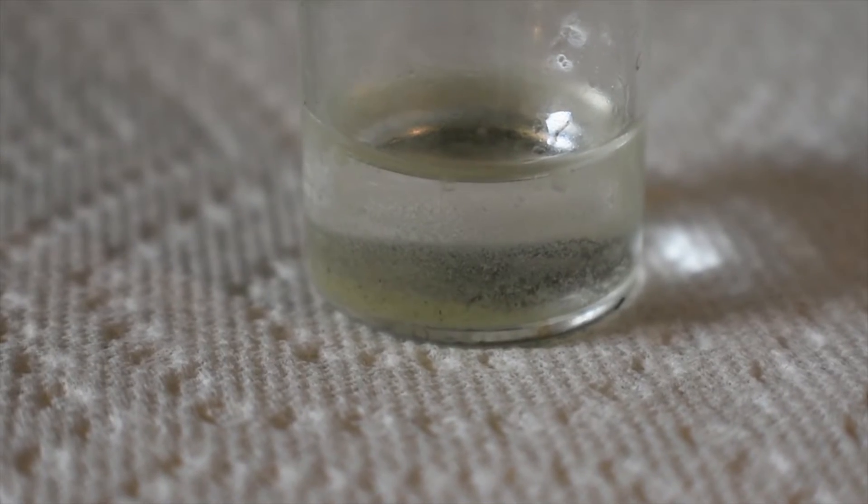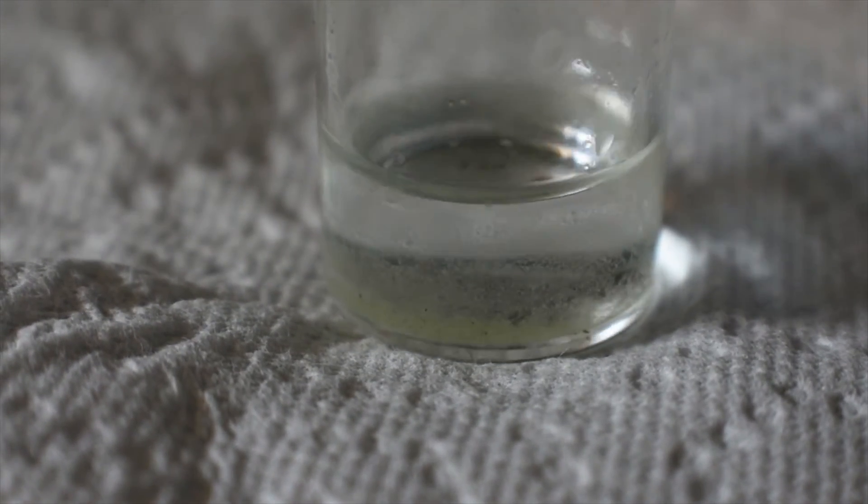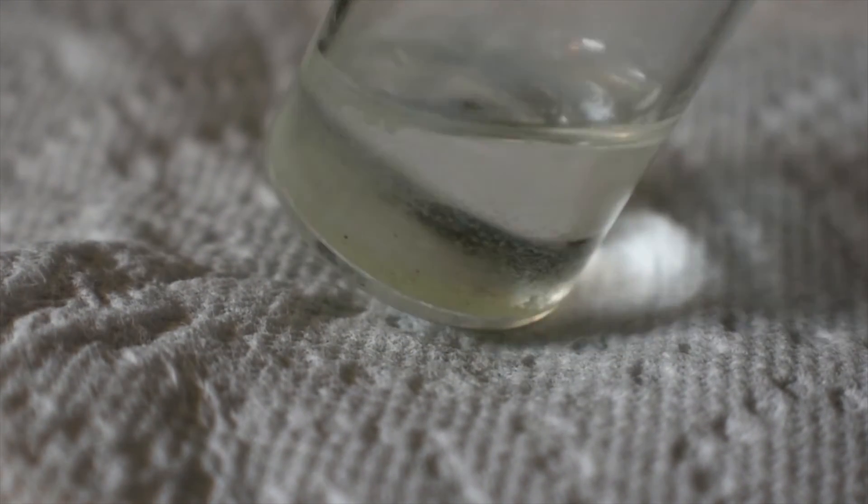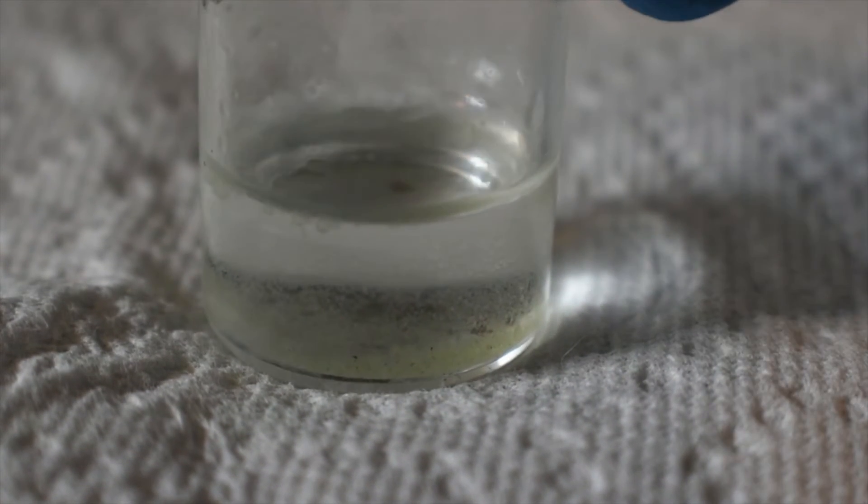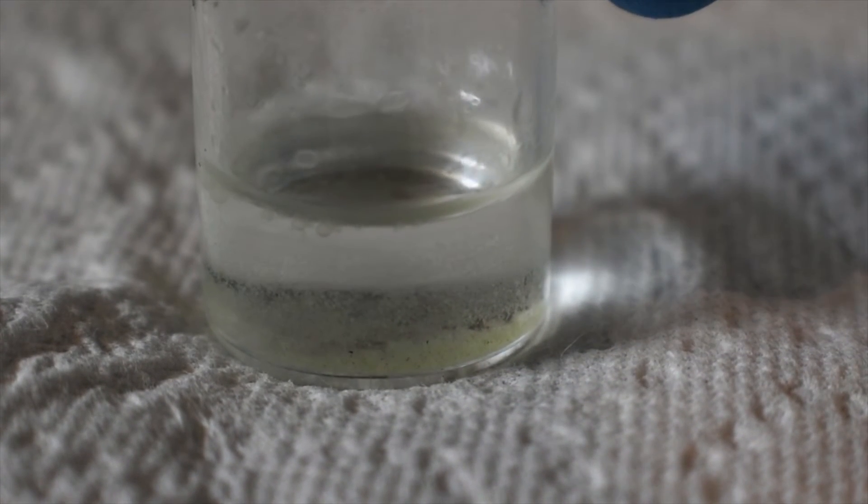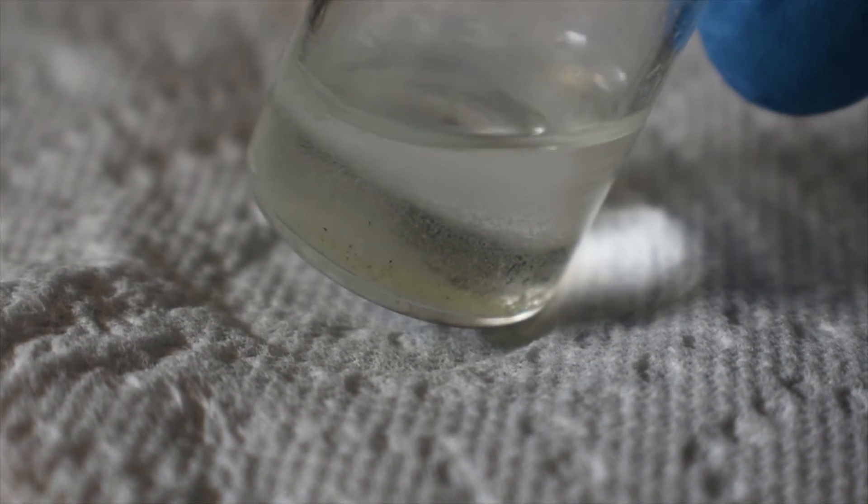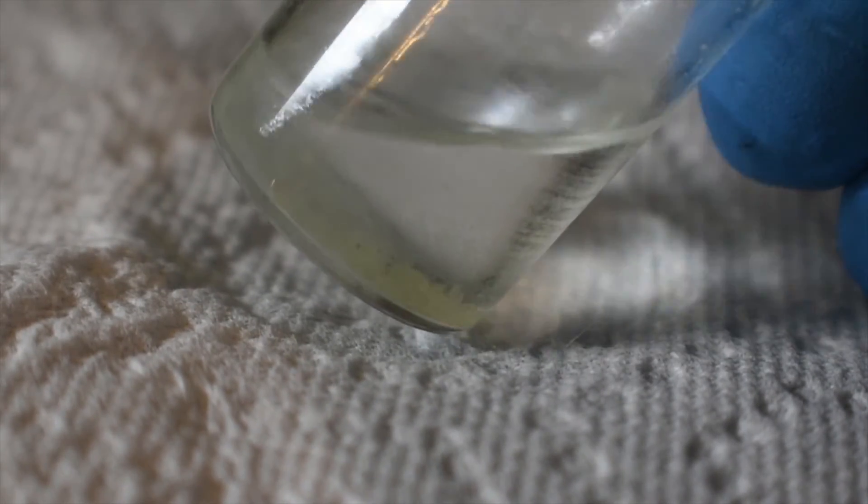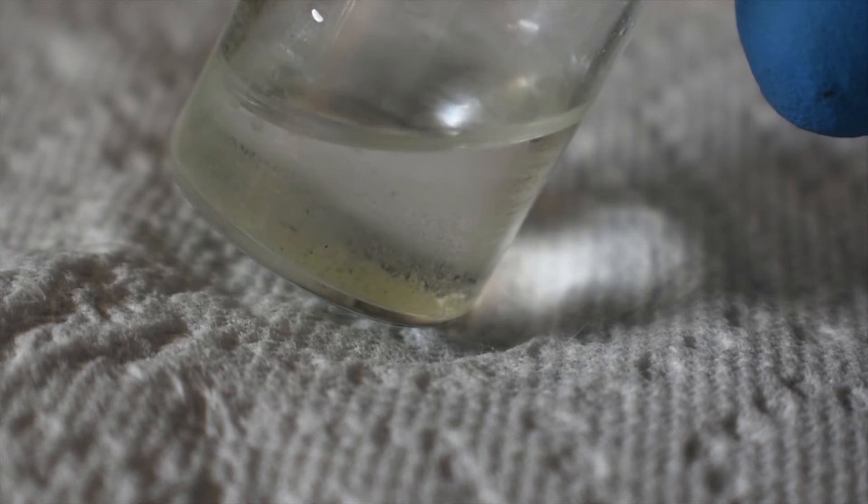Here's a small amount of the solid complex from an earlier run. Let me wipe off the condensation. You may be able to see the pale green color of the solid complex at the bottom of the dram vial. As you can see, the solution is practically colorless. That means that all, or nearly all, of the uranium-6 has precipitated out as the 18-crown-6 complex, which is the pale yellow-green solid that you can see at the bottom.